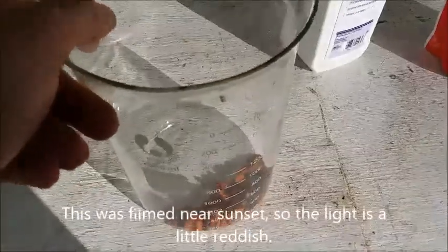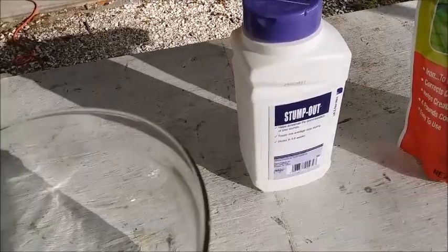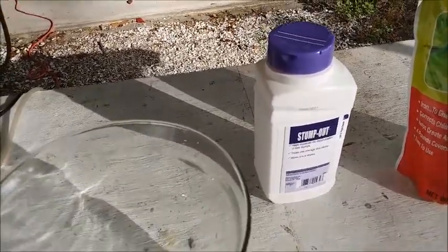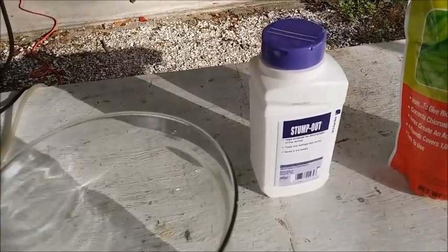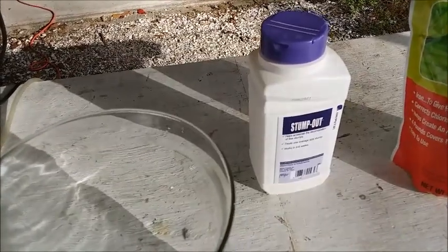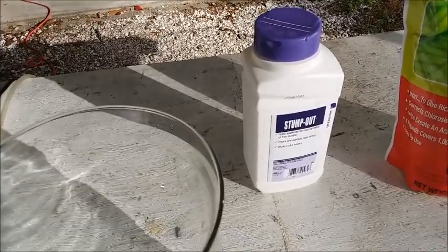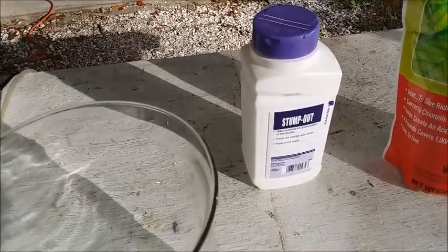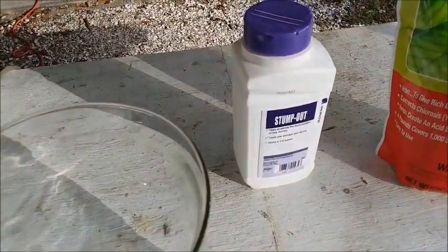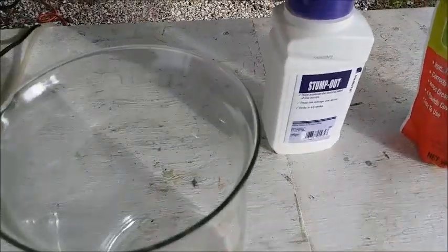I'm trying something new. Normally I will dissolve and re-precipitate the gold three times, precipitating each time with sodium metabisulfite. But the last time I took gold to the jewelry store they were telling me it was only like 22–23 karat — it wasn't full 24 karat. And I didn't like the look of some of the gold; it looked like it had something else in it, probably some platinum group metals following the gold through all the precipitations.